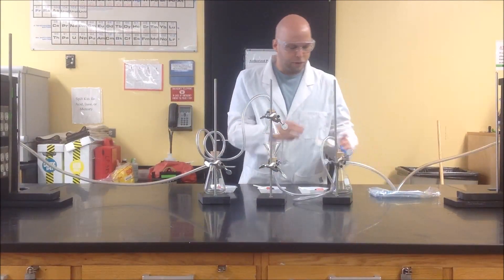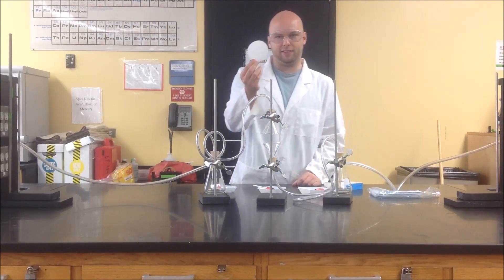Similarly, we're going to have the second-hand smoke being collected. The second-hand smoke is going to rise up from the cigarette, go through this tube, and into this stopper. Again, we're going to have a filter paper on this stopper to collect all of the sediment. In order to figure out how much cigarette smoke is being collected onto a filter paper after the cigarette has been burned, we have to first weigh the filter paper, and then subtract the original weight from the final weight to tell us exactly how much was collected.